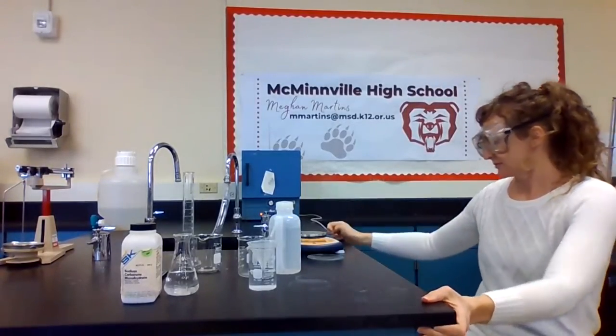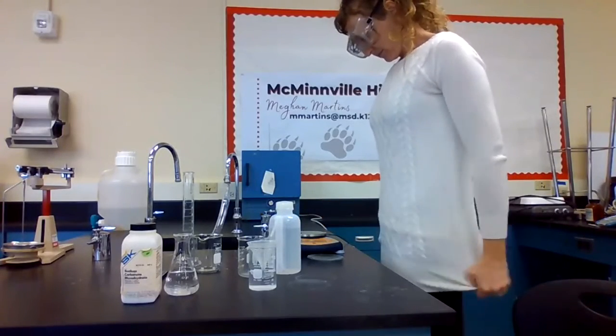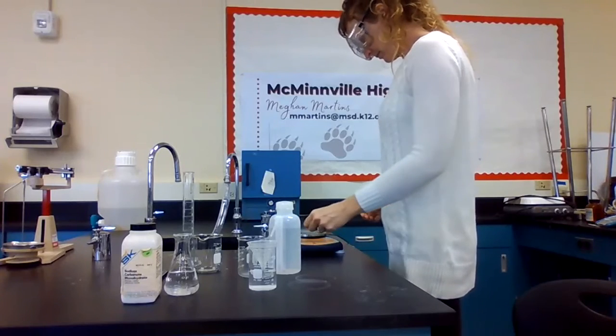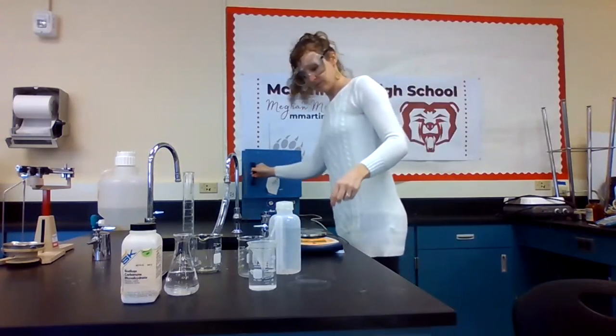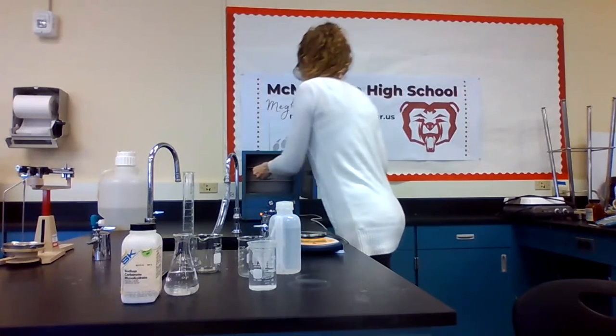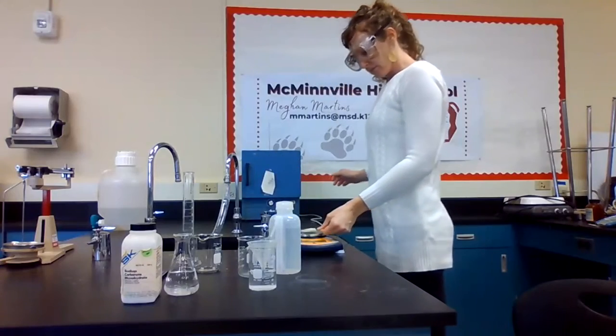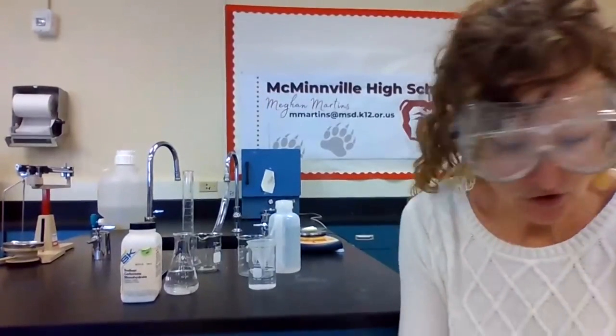Data point 4. .7. So let's call that data good.